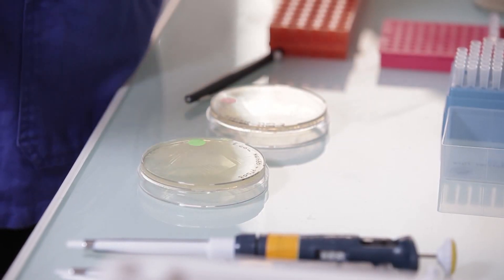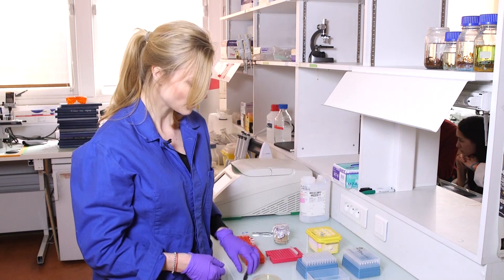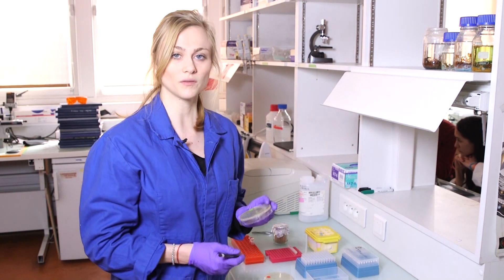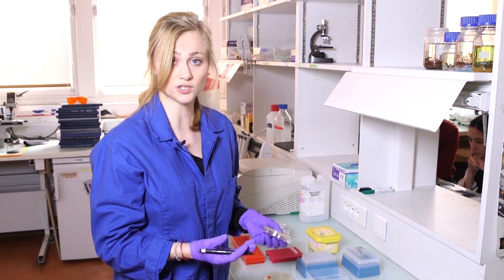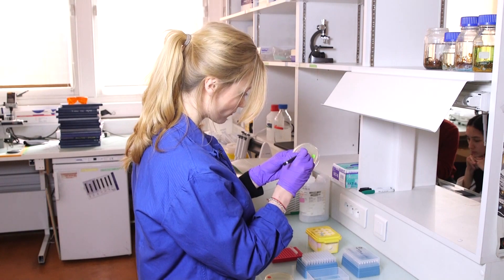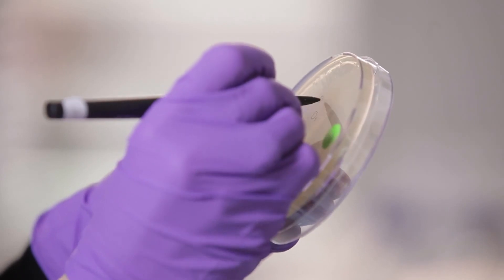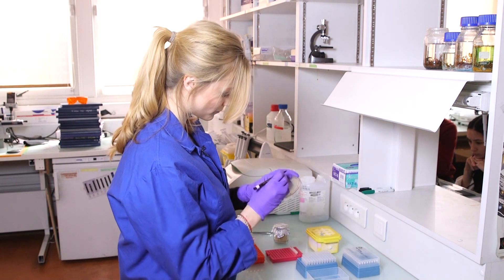Before I can start to prepare the PCR reaction mix, I first have to release the DNA from these cells, because otherwise they're not accessible for the polymerases that need to amplify the DNA. I'm going to mark three colonies on this plate with the bacteria that carry my plasmid, to know which colonies I actually checked.